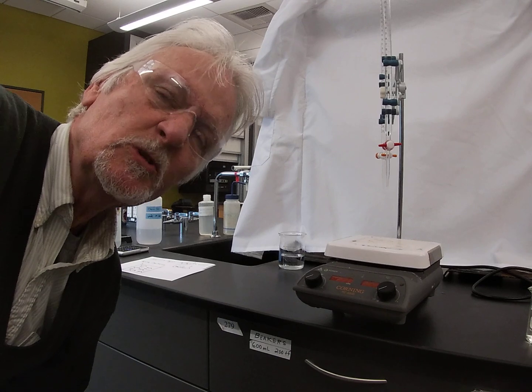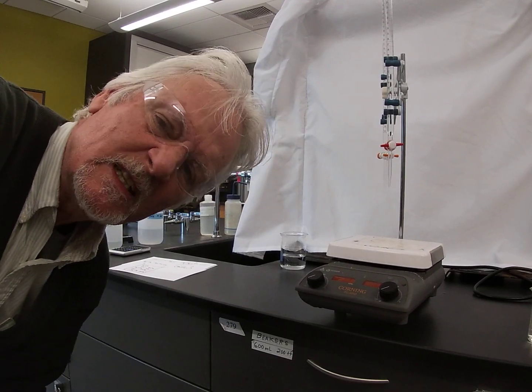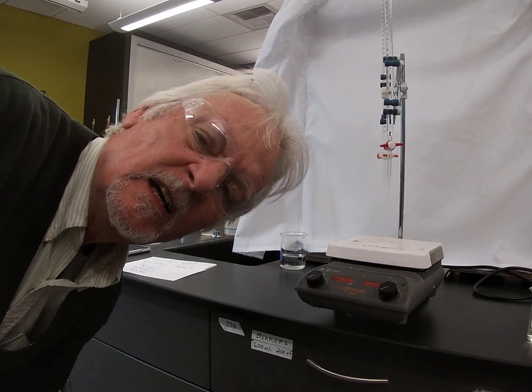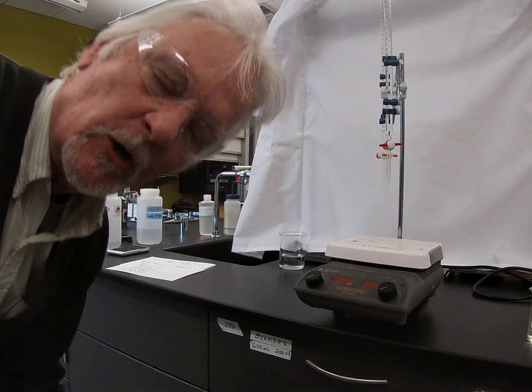Well, hello again. Today we're going to investigate the properties of buffers. Buffers are special solutions that consist of a weak acid and a salt containing the conjugate base of that weak acid, and they have the magical property of being able to resist changes in pH, and they're super important in all sorts of environmental and biological systems. This is a quick demo to help you visualize how they work.